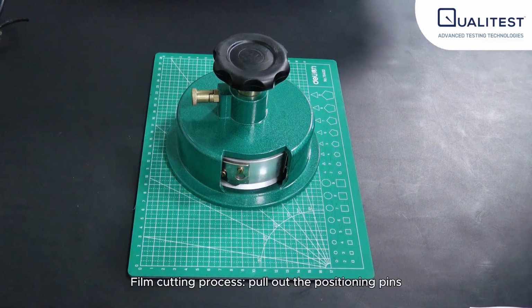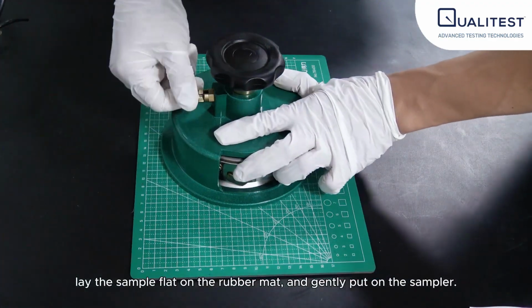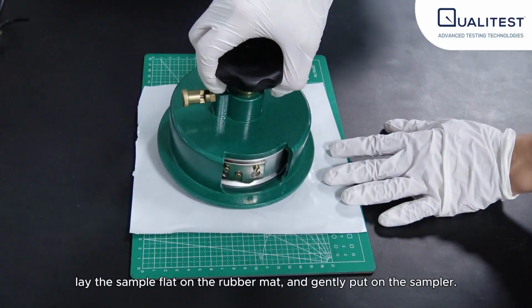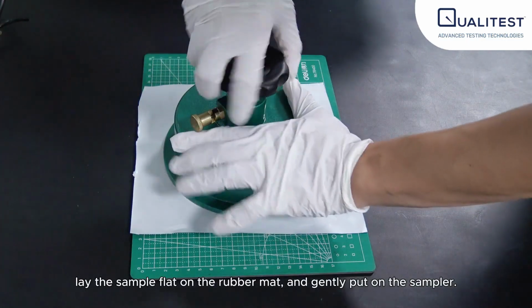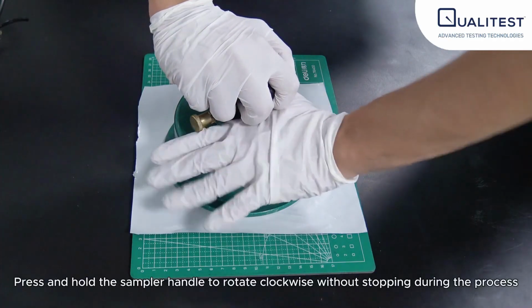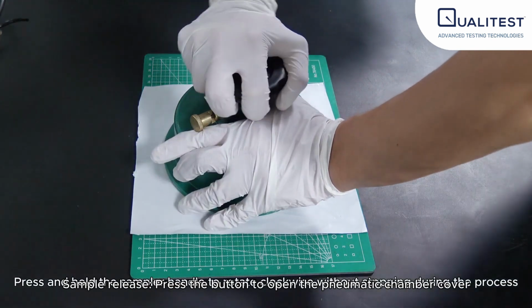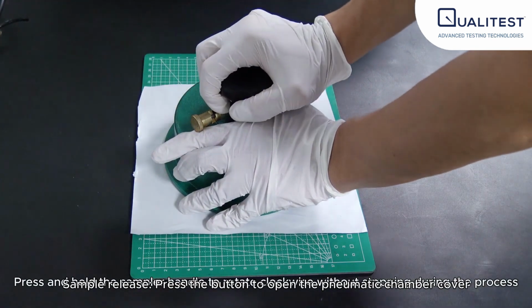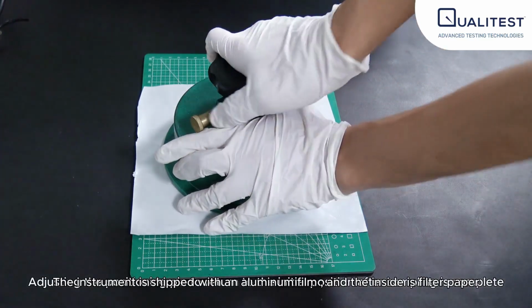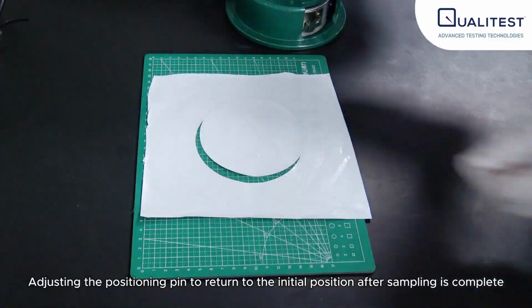Film cutting process. Pull out the positioning pins. Lay the sample flat on the rubber mat and gently put on the sampler. Press and hold the sampler handle to rotate clockwise without stopping during the process. Adjust the positioning pin to return to the initial position after sampling is complete.